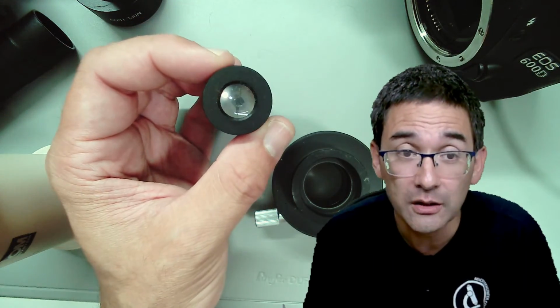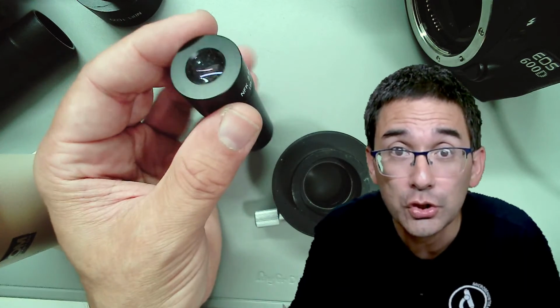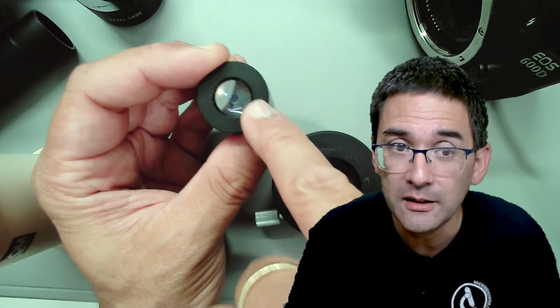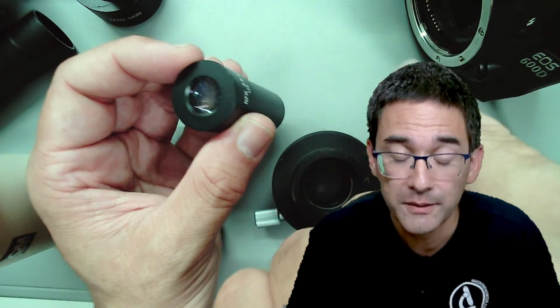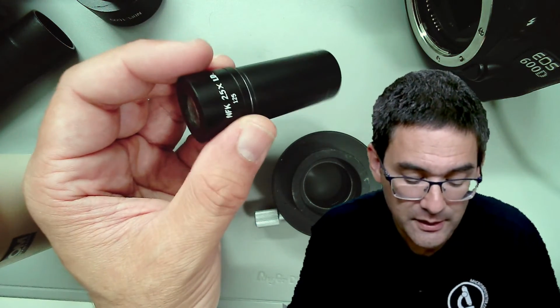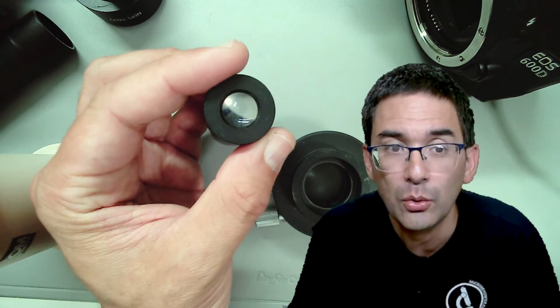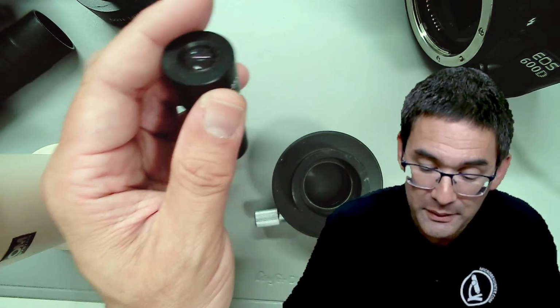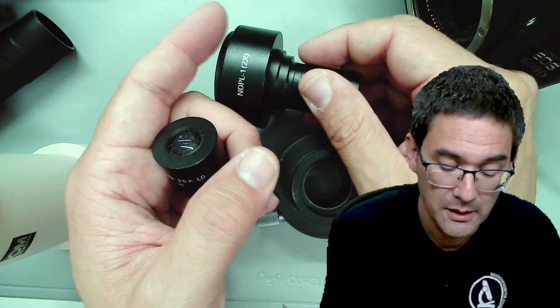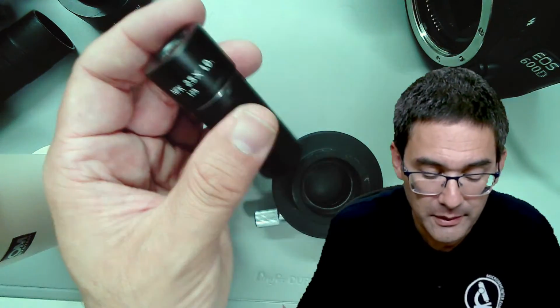So with that one, I got pretty good results, because the optics here were specifically calculated and designed to match the objectives. So they kind of cooperated and worked together. This is indeed something that you only get if you stay with one company, and you cannot get that if you take a generic adapter like this. So this is a little bit of a drawback.